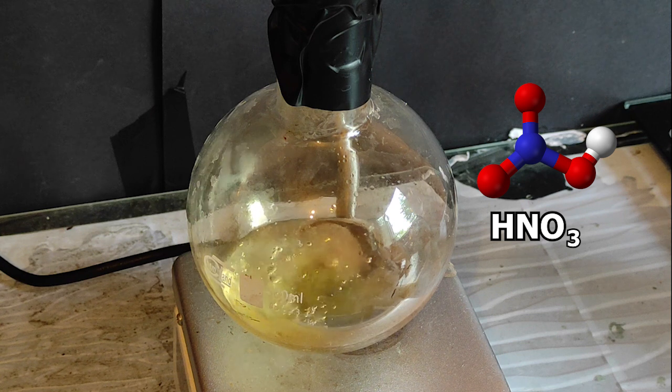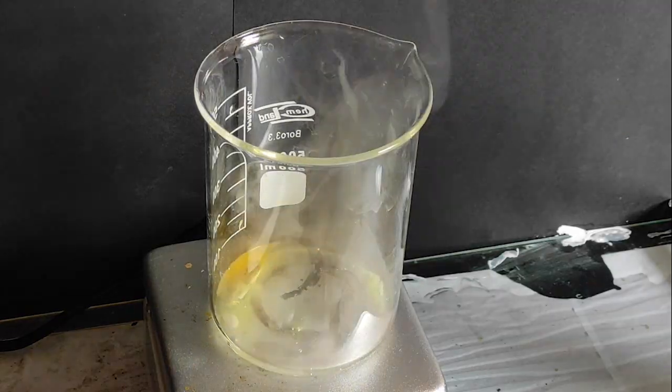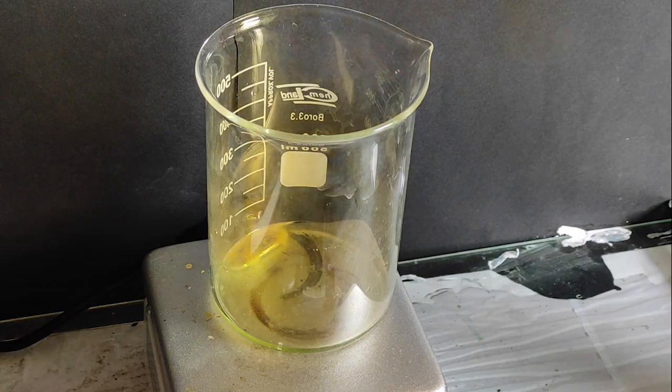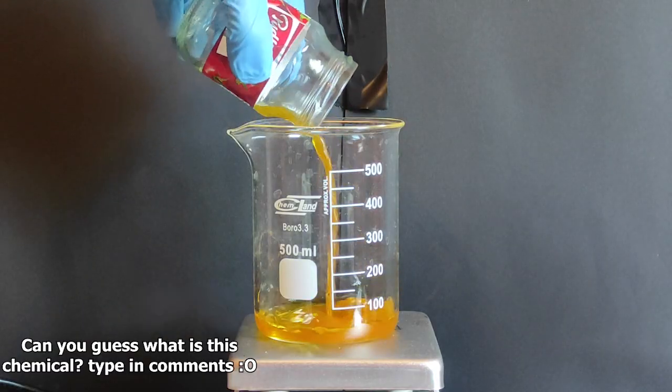I believe that nitric acid is one of the most exciting acids that you can have in your lab. When you dissolve metals in it, it looks really cool and it's also a gateway to a bunch of nitro molecules.